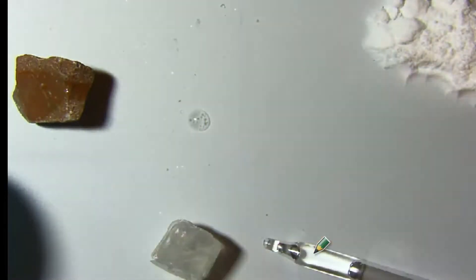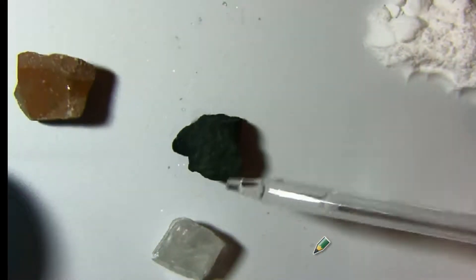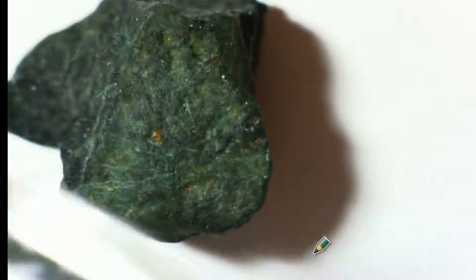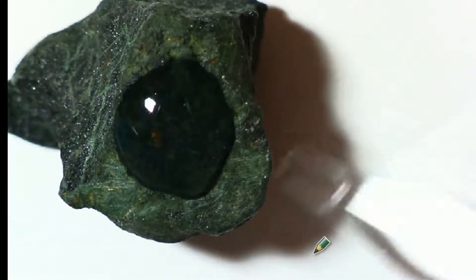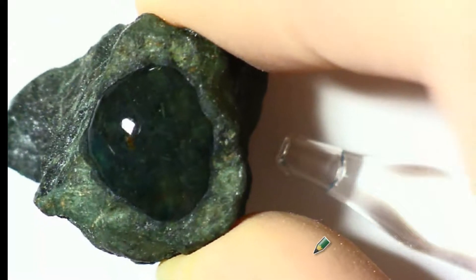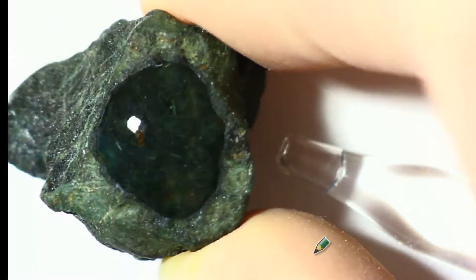Let's test, what do we have next? We've got chlorite. We'll drip a little bit of this on chlorite. All right, let's get in close. I'm going to brighten it up a bit. Okay, I'll fix it. Don't worry. I got it. Here we go. We'll drip some of this on chlorite. And let's see what happens. And we'll watch and we'll wait. Sometimes it takes a few seconds. You've got to sit and wait. Nothing really is happening on this one. It's just doing nothing. We'll put it on the side in case it starts to fizz a little later. Sometimes they do that. Sometimes they just got to take a while.